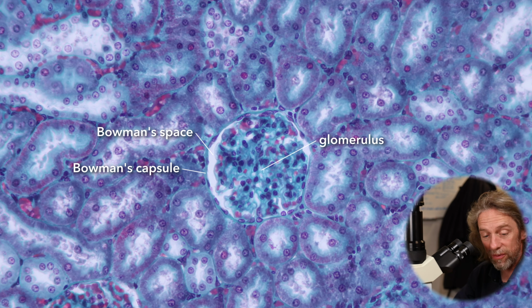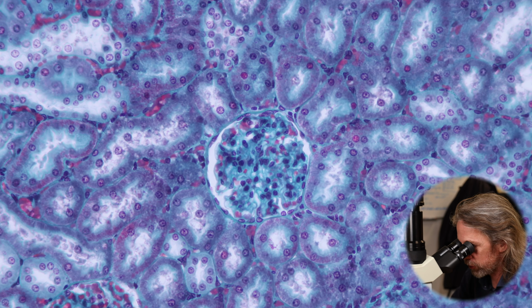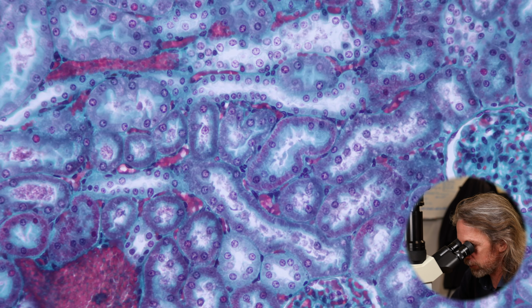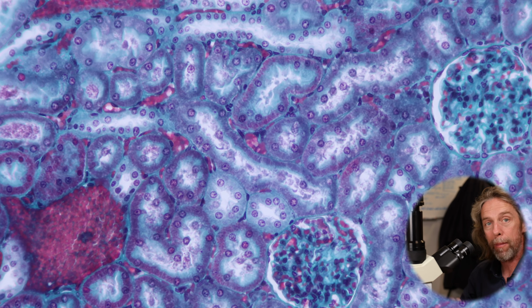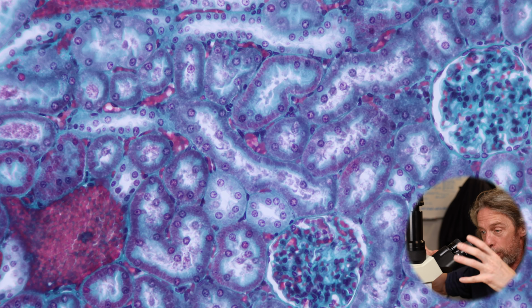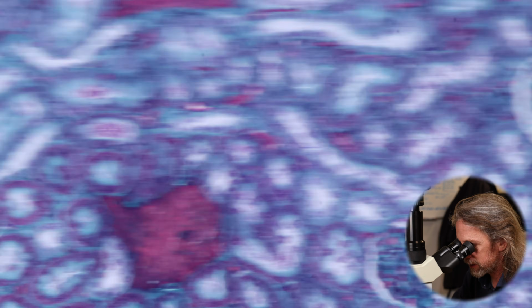So we're seeing lots of circles around the glomerulus. So these are those tubes running in different directions, and we're seeing ovals. So those ovals are tubes caught in a glancing blow, and some of those ovals are longer than others. So we're seeing the shape of the tube. But imagine we had that proximal convoluted tubule, and we had the distal convoluted tubule, and they're around the glomerulus. They start here and they come back up here as well. So that's what we're seeing there.